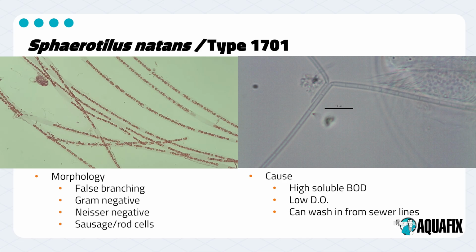S. natans / type 1701 is a filament that has that false branching morphology that we mentioned before. You can see this very clearly in the right-hand picture, where when you're zoomed out, it would appear that this filament branches, but as you look closer, you recognize that it's actually two distinct filaments that are kind of laid right next to each other and then diverge, as opposed to being truly a single cell which has branched into two more cells. It is a sheathed filament with sausage rod-like cells, and it is gram-negative.